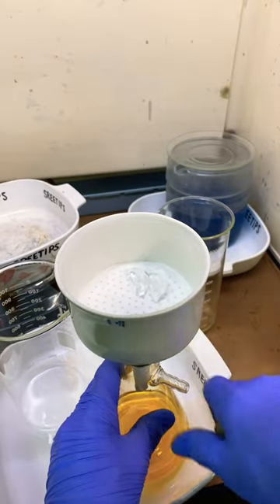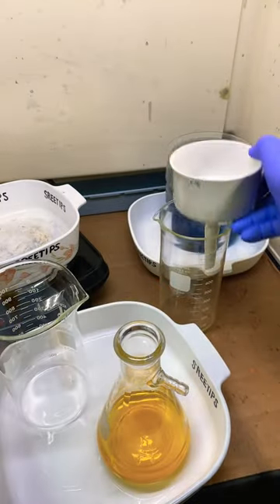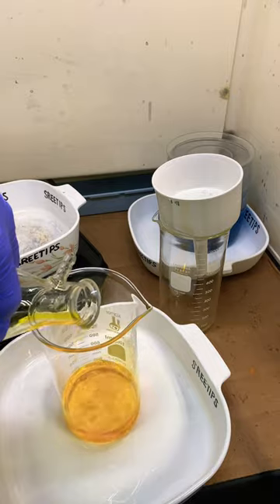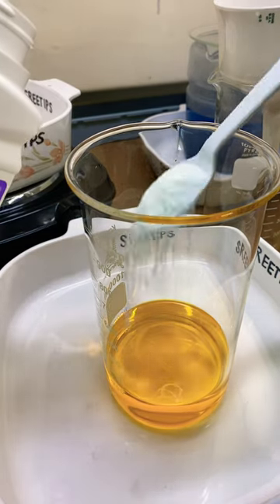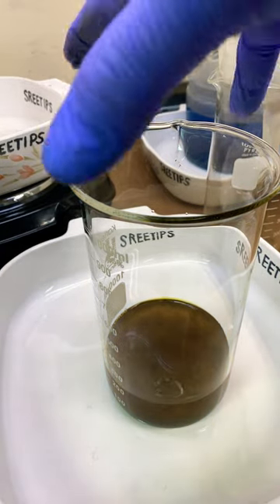Now I'll transfer the gold to a clean beaker. Here comes the fun part — I'm going to precipitate out the pure gold a second time with some stump out. Pour to a clean beaker.